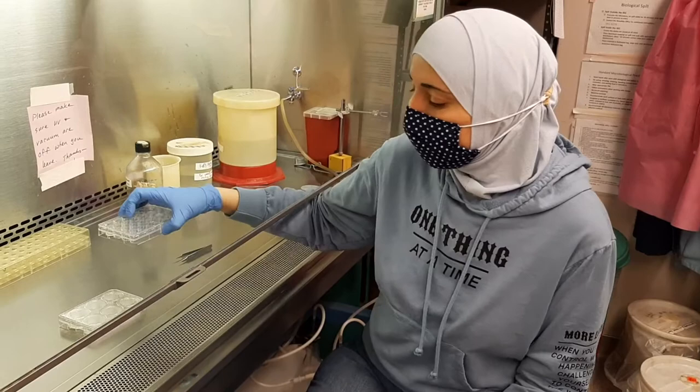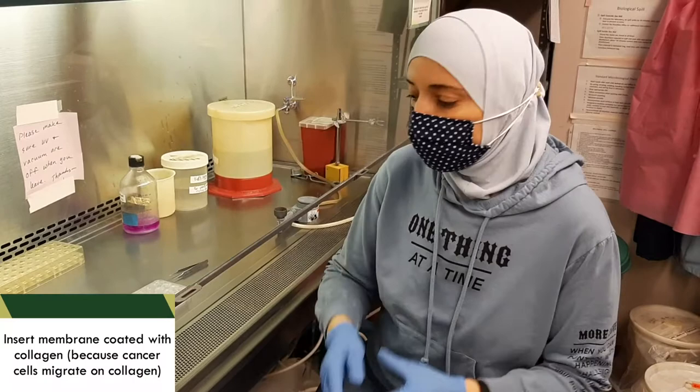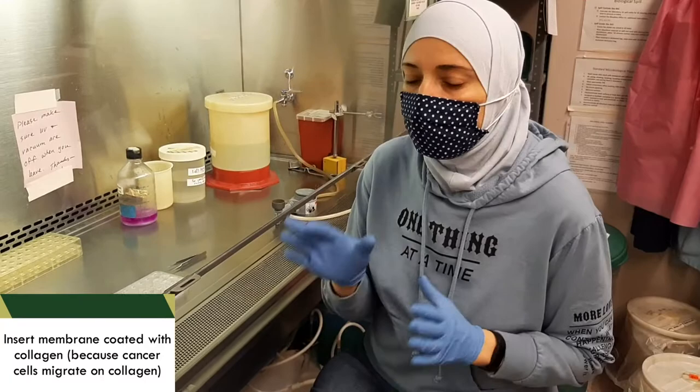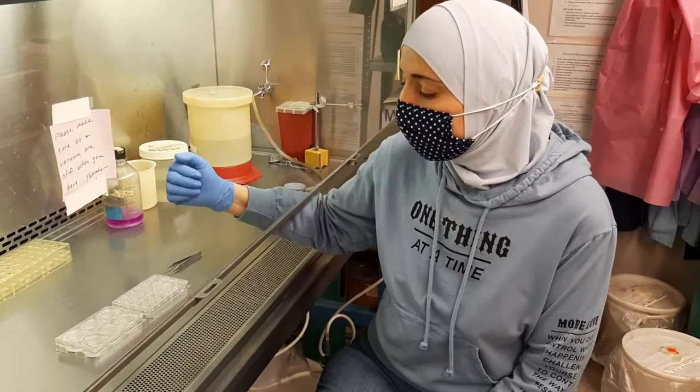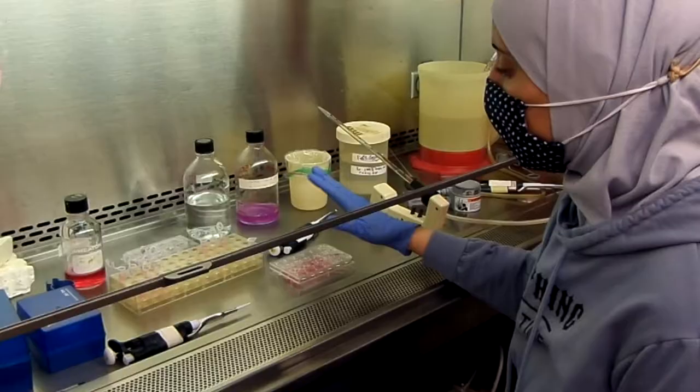I coated the lower membrane with collagen for four hours. Now, I will trypsinize the cells and count the cells in all of my treatments and the control. Then, I will grow or seed the same number of cells in all of the wells, treated cells versus control, because I need one variable, which is the effect of the treatment on cell migration.